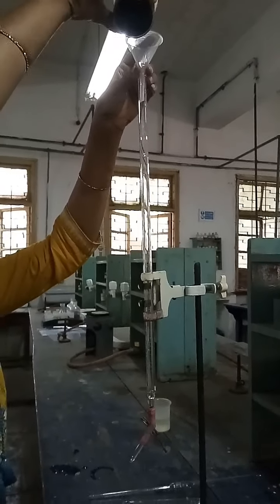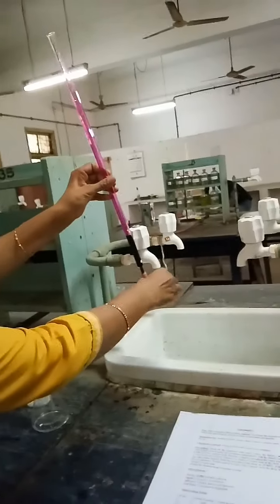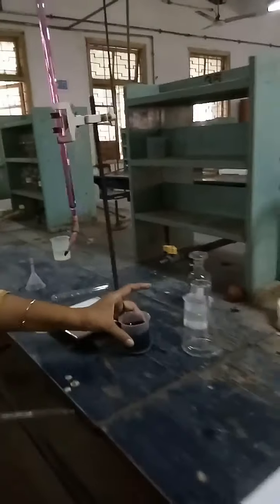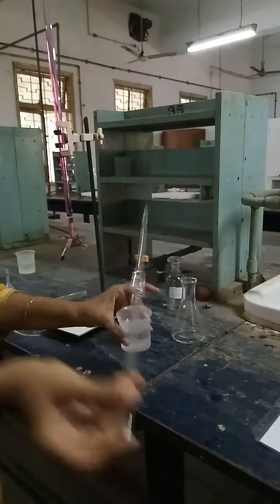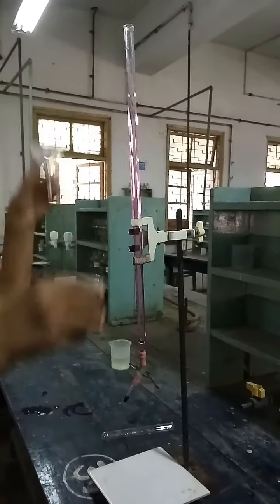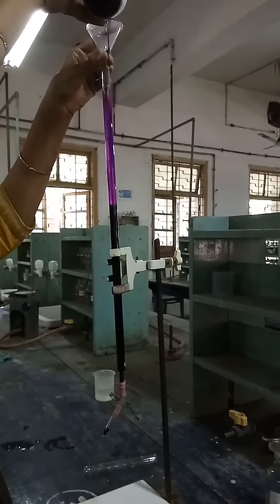Now we rinse the burette with KMnO4 solution — here we are rinsing the burette. Now we rinse the pipette with oxalic acid solution like this. Now we will fill the burette with 0.09 normal KMnO4 solution.